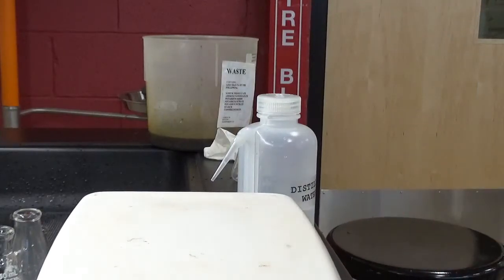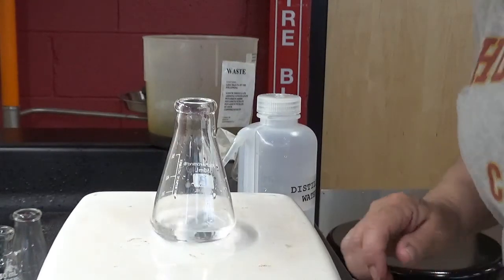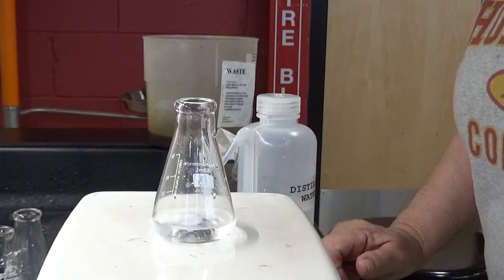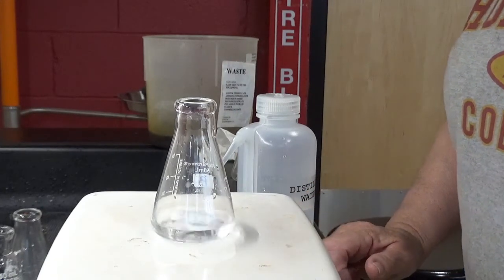All right, let's see how this goes. So this B, this is A. Just don't show them the letter. No, I won't. Oh my God. So we're going to try number 8. Experiment number 8. We're going to try to do this once.